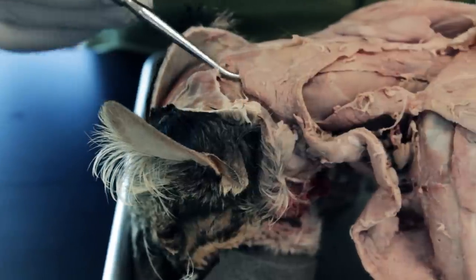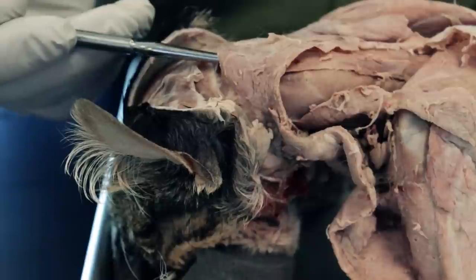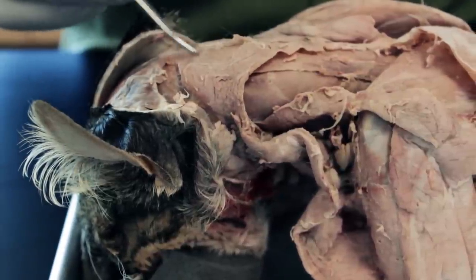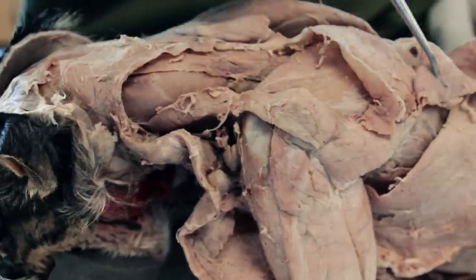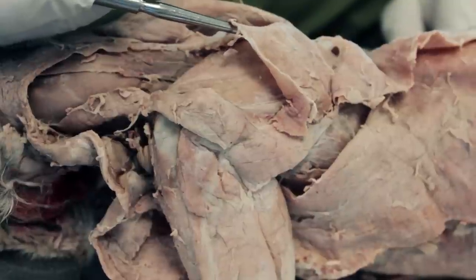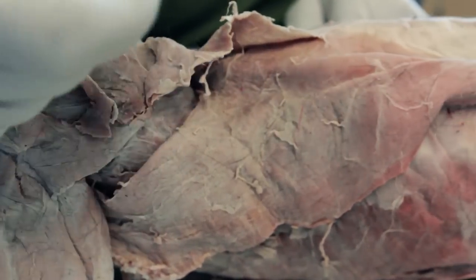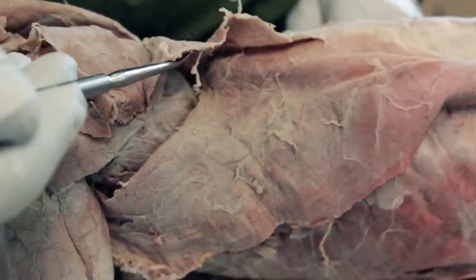The next muscle group is another trapezius muscle — this is the clavotrapezius. The clavotrapezius is over the neck of the cat, and this is one of the three trapezius muscles. As we move further down the cat towards the shoulder area, the superficial muscle that covers the scapula is the acromiotrapezius. As we move posterior to that, the one behind the shoulder is called the spinotrapezius. This sits superficial to the latissimus dorsi.